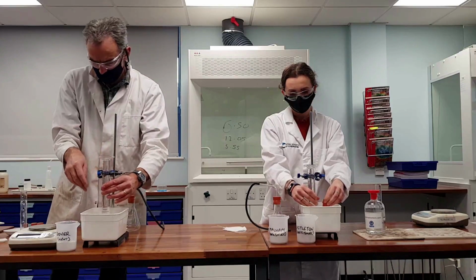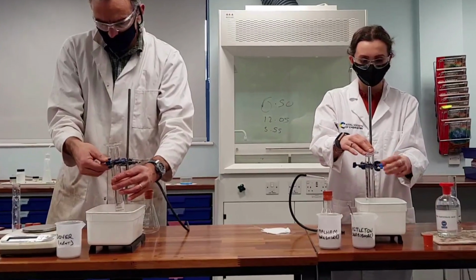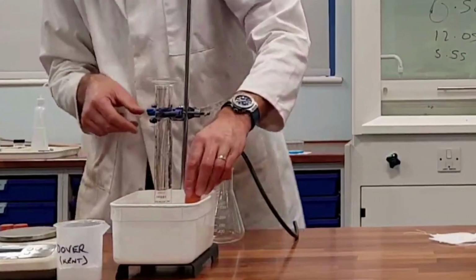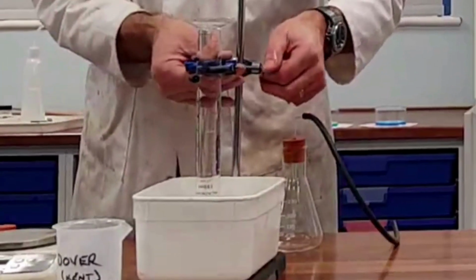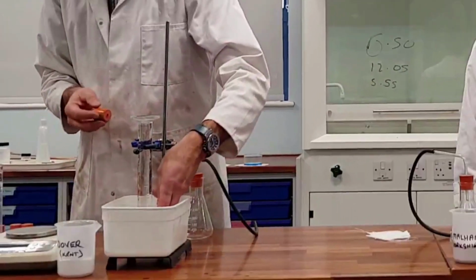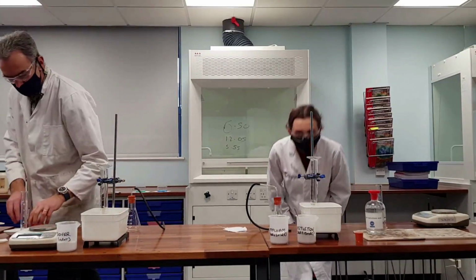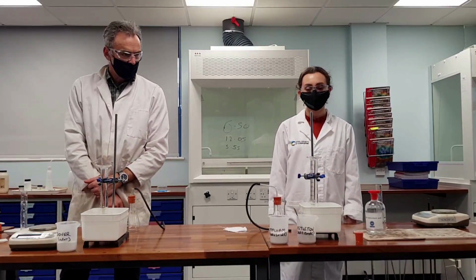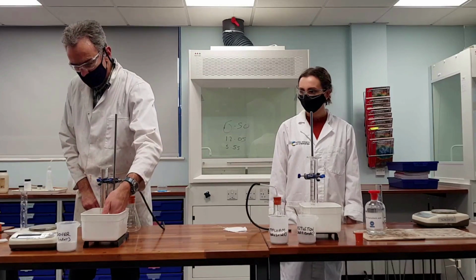They put their hand over the end, they used a bung to help them, and that measuring cylinder that Miss Richardson has just inverted and the measuring cylinder that Mr. Reeves has inverted are both absolutely full of water. So we'll show you a diagram of how this is set up, but those measuring cylinders are full of water. The key thing here is there's no air in those measuring cylinders. So we know if we measure 10 millilitres of gas, then that will go down to the 10 line on the measuring cylinder.